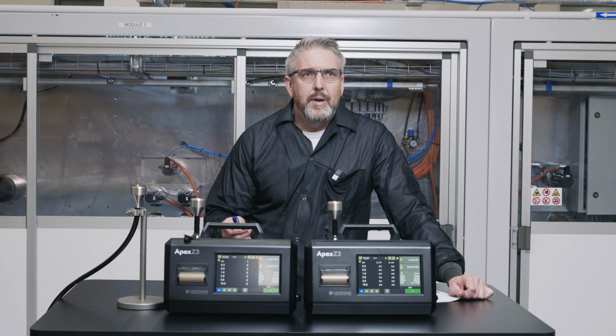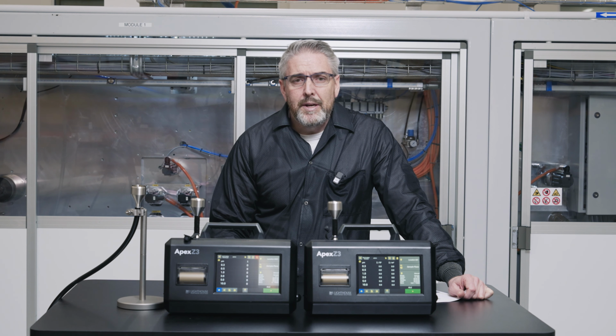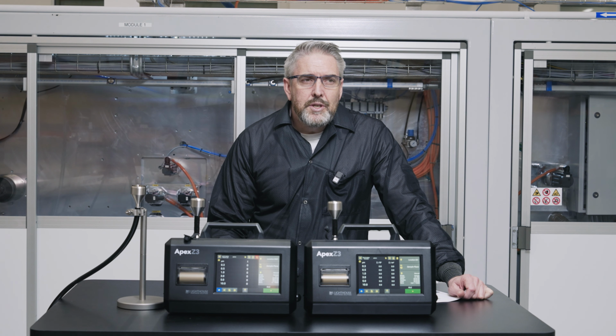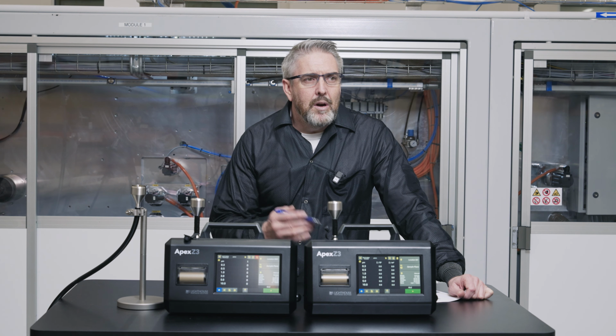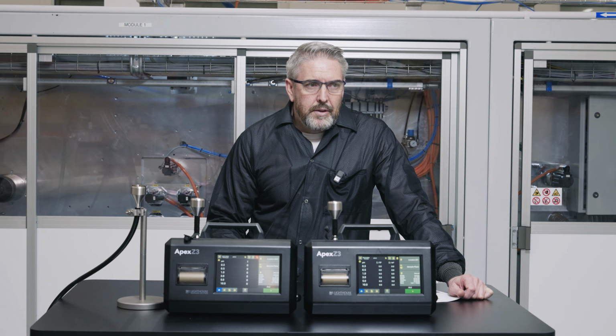companies have been affected because they've had previous installations where the sample tubing has been long, with a number of bends in that tubing. And these are the issues that we want to address when we do have long lengths of tubing and a number of bends in the sampling system. There are issues related to particle losses.